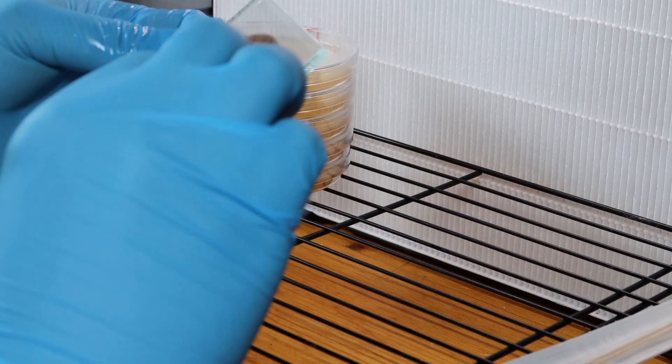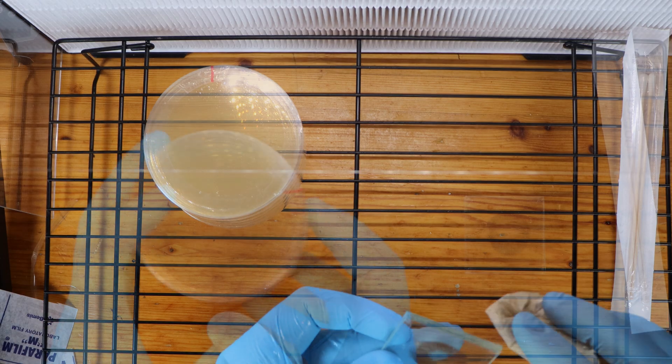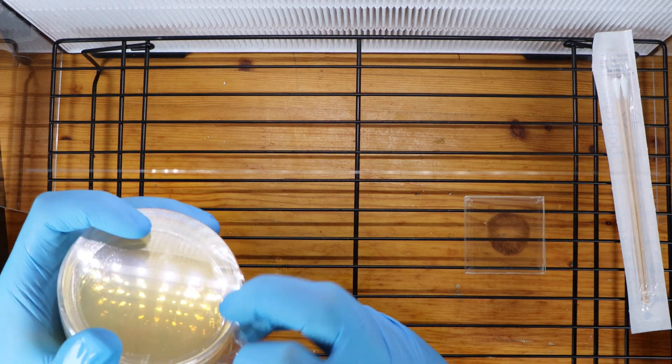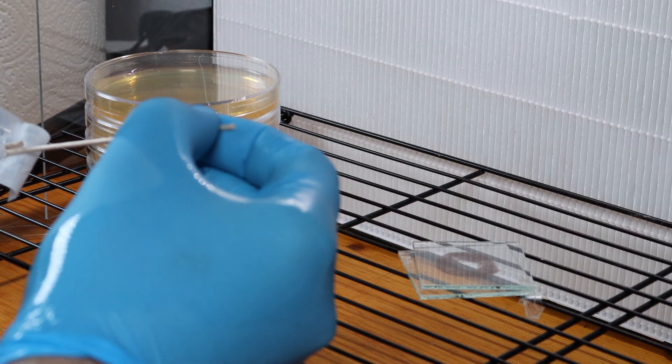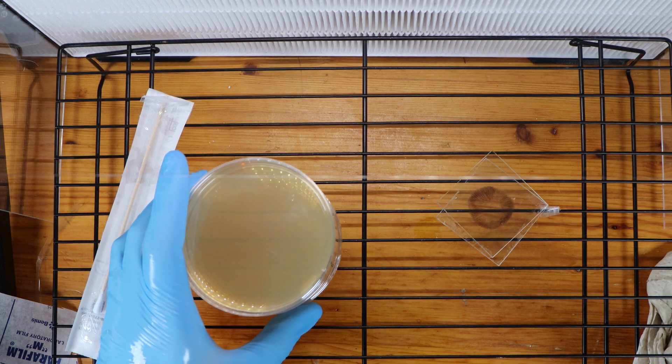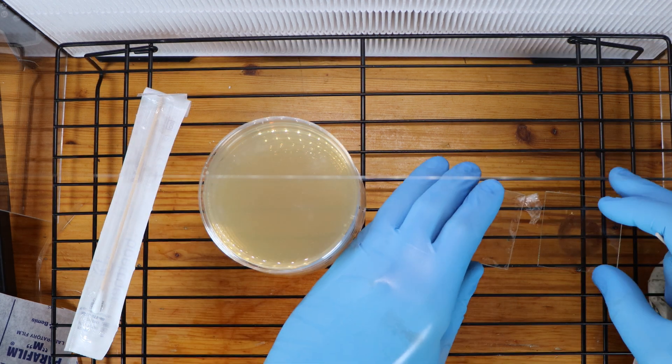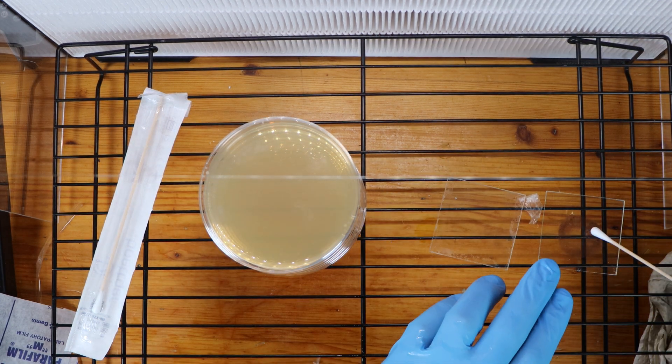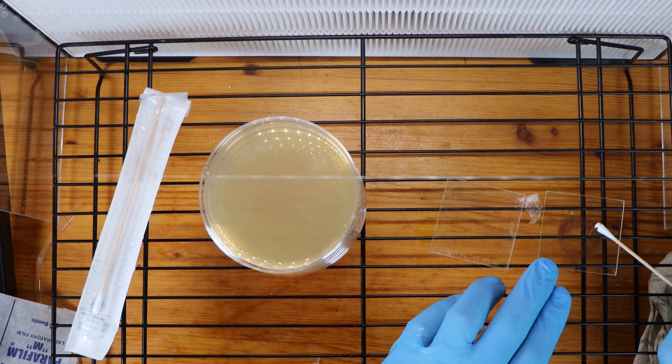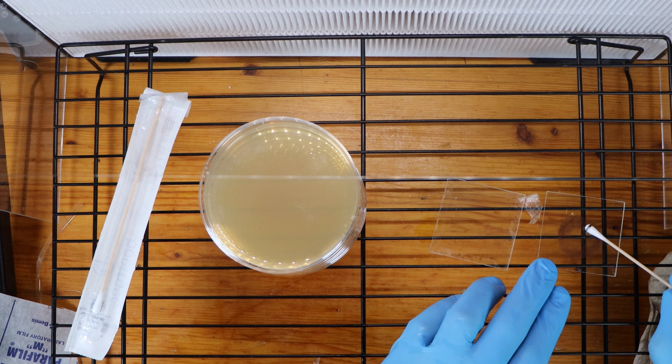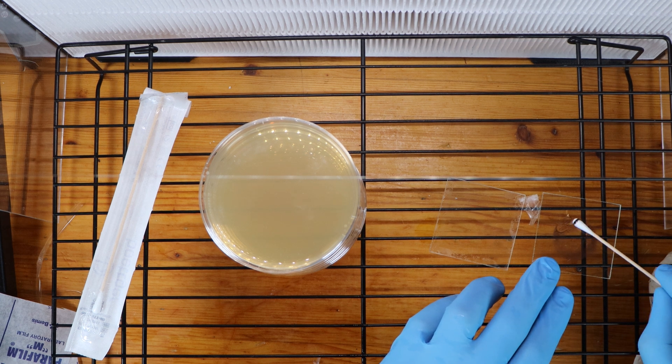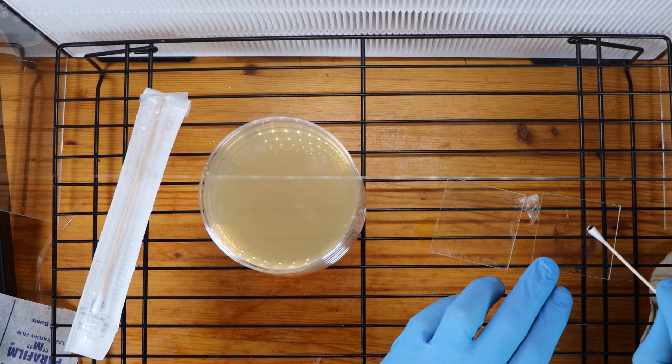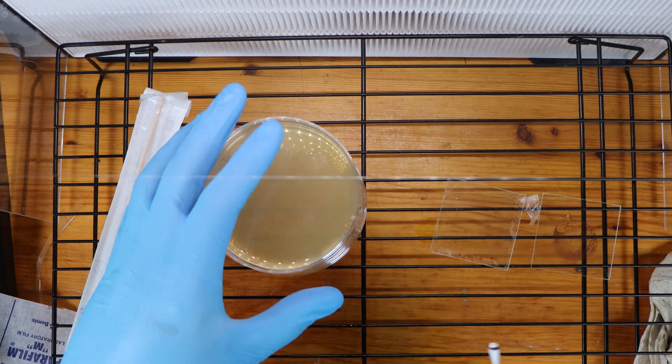Now even though I am using a fan filter unit, this procedure can be done inside of a correctly prepared still air box. Okay, now that my spore print is open, it's simply a matter of taking the swab and picking up some spores. Probably picking up far too many here, but that's okay.